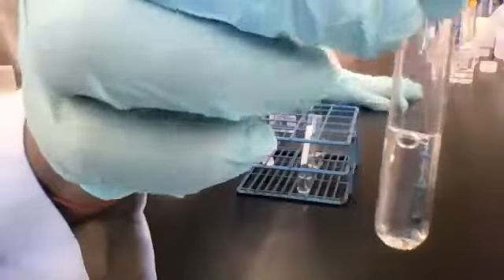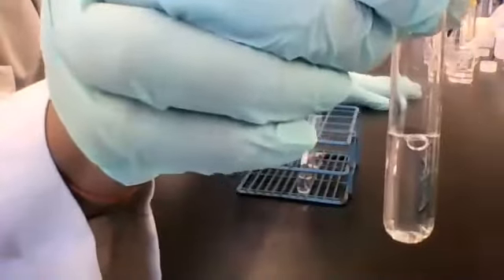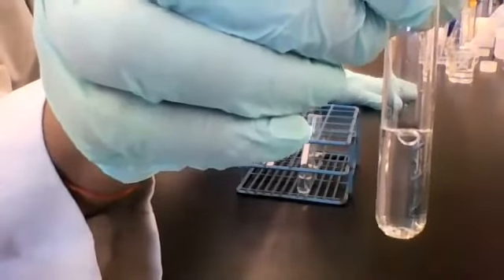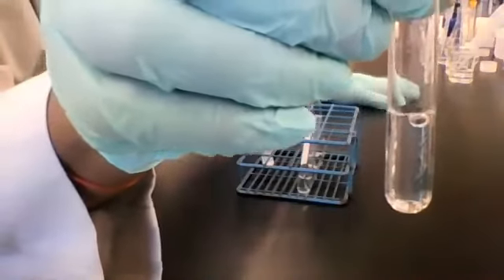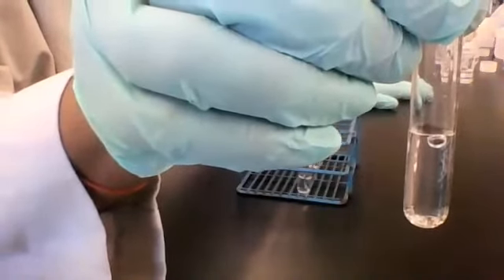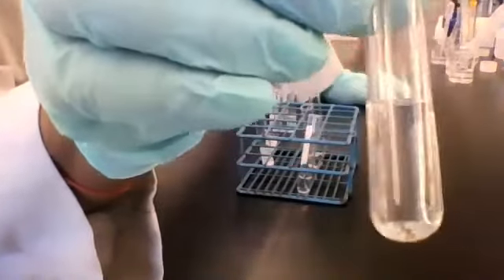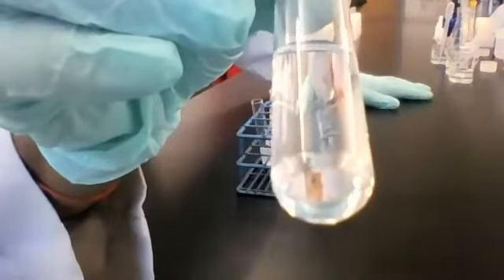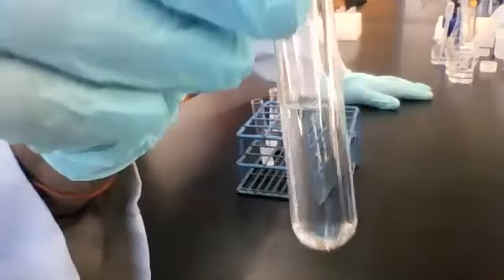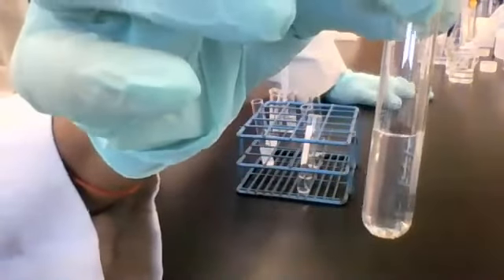All right, here's the result. This is the resulting mixture of solution 3 combined with reagent C. Here's the bottom of the tube. Anyone's curious? Here's the resulting mixture. You write what you observe here.